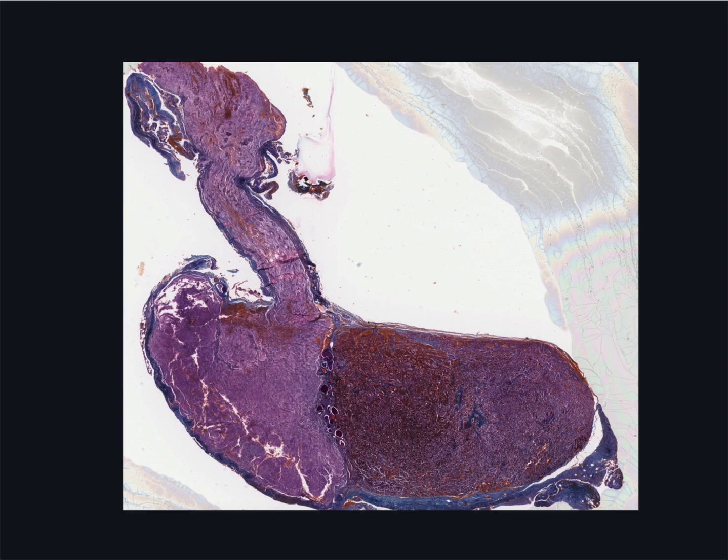This is a mid-sagittal section through the pituitary gland as it appeared in the previous gross anatomy image without all the surrounding structures. Anterior is over here and posterior is over here. The pituitary gland has two fundamental divisions. The anterior adenohypophysis is derived from oral ectoderm, and the posterior neurohypophysis is an extension of the brain.